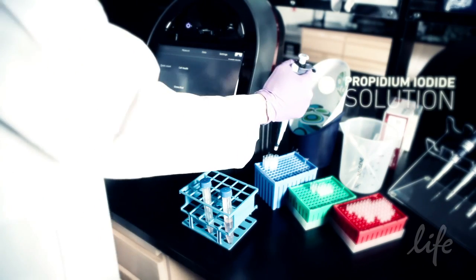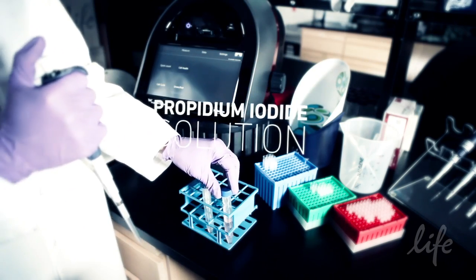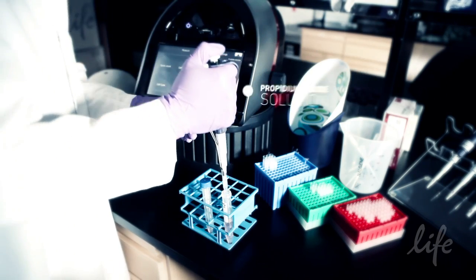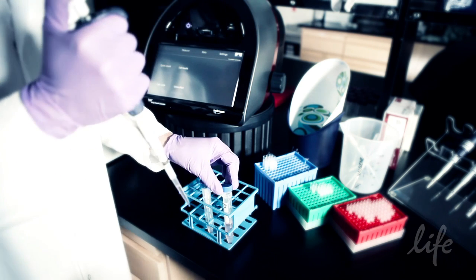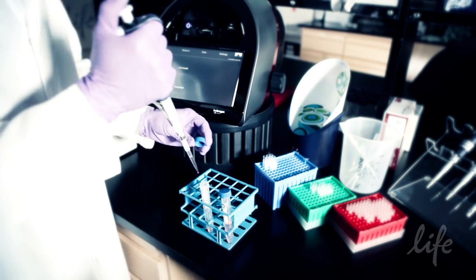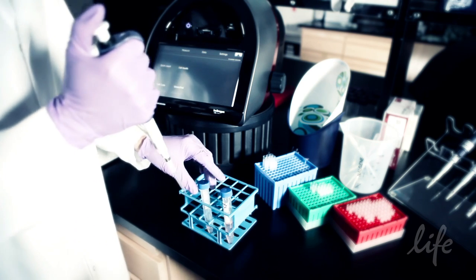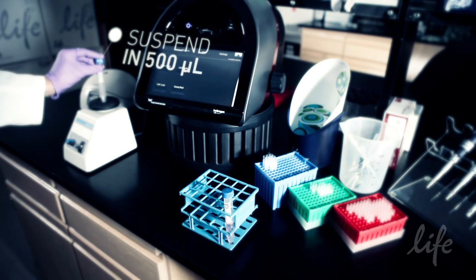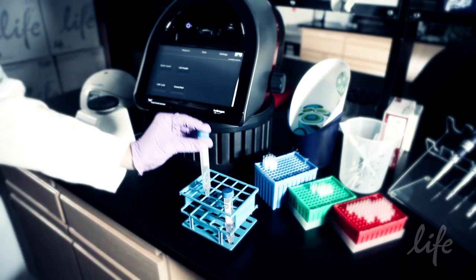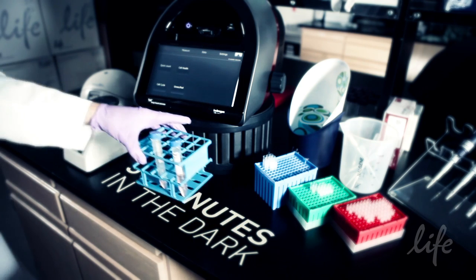The propidium iodide solution is used to identify stages of the cell cycle in a population. This assay works well on cell suspensions containing from about 1 million to about 5 million cells per milliliter, so the concentration doesn't need to be exact. Resuspend the cells in 500 microlitres of the propidium iodide solution and incubate at room temperature in the dark for 30 minutes.